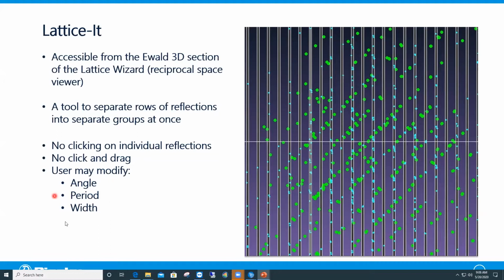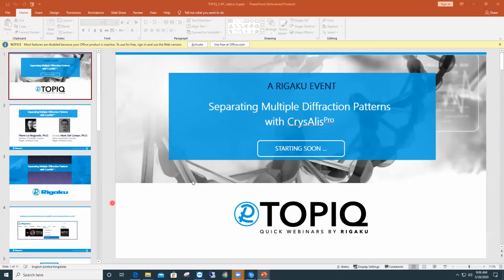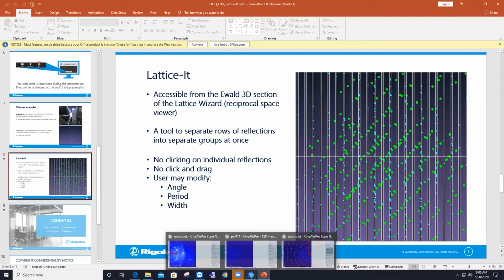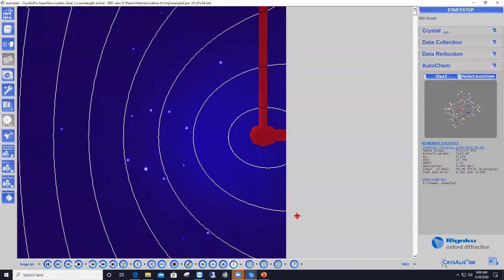So by modifying these three parameters, you can control exactly the reflections that you imprison within the bars, making sure that you capture the reflections from one diffraction pattern only, and not any reflection from the other diffraction pattern. So let me now minimize this view and jump right into our first example, the ice dataset.